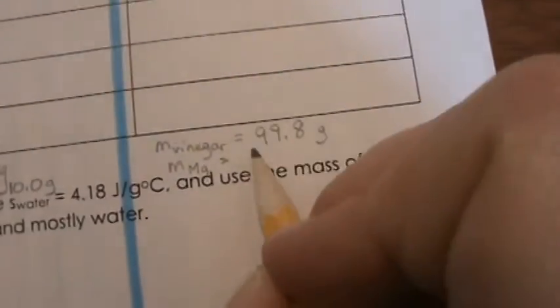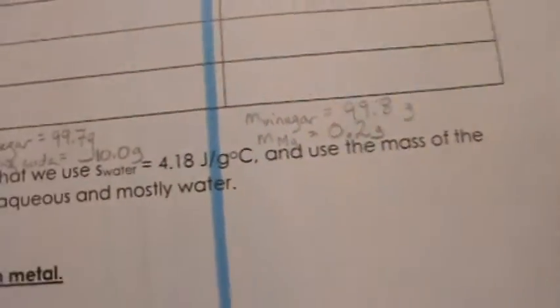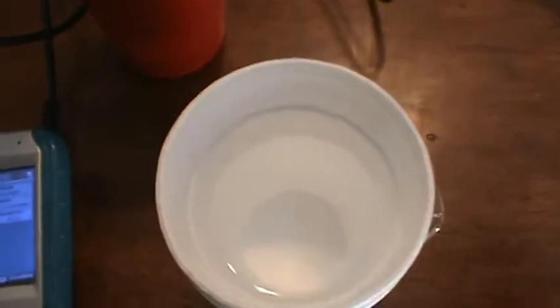Okay, well, I forgot that this scale doesn't do 0.1 grams. This scale does 0.2 grams. So we're going to go ahead and go with 0.2 grams. Okay, so here is the mass that you're using here, 0.2 grams. And this one won't be super exact because I don't have great significant figures available with this. All right, so here we go. We're going to bring this over here. And we're going to start this again.